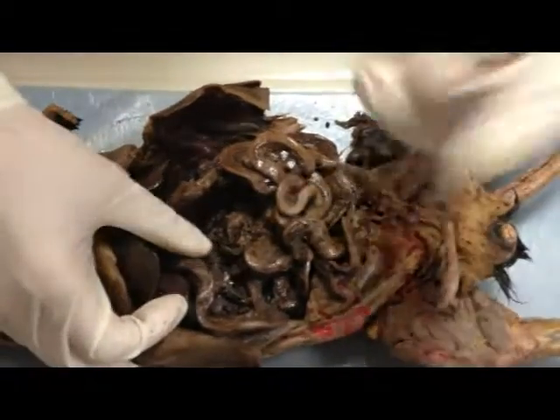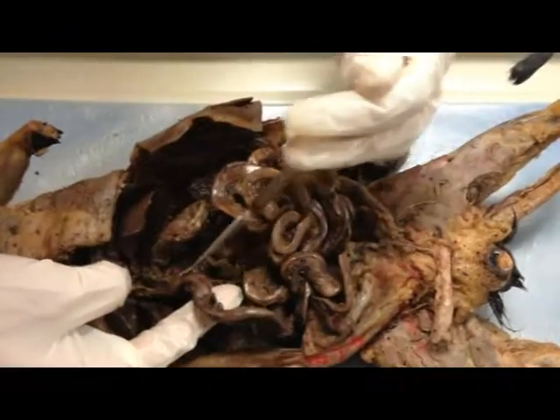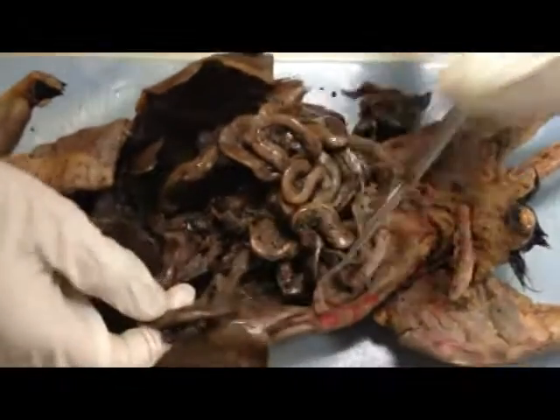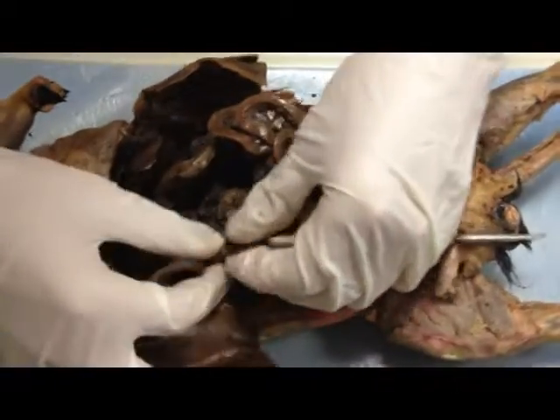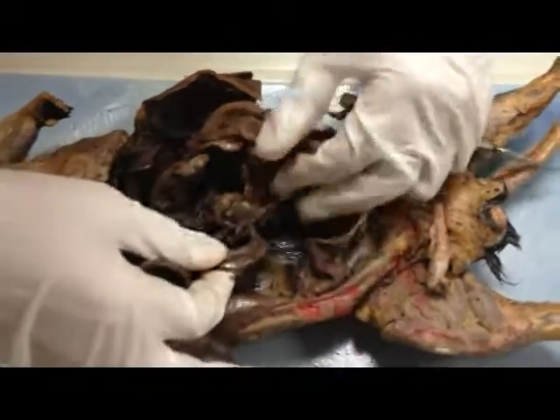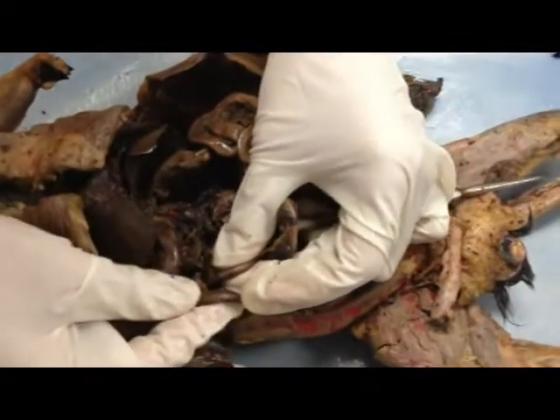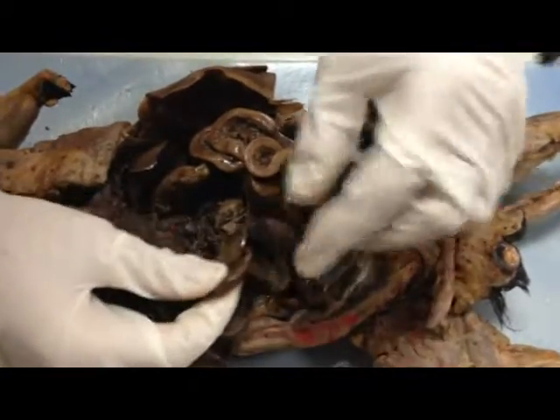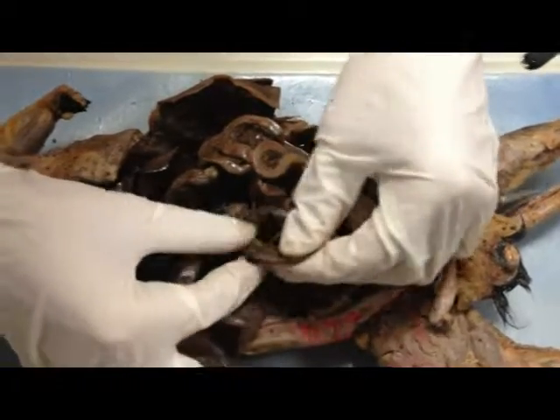This one right here is a darker tint — it's a lot darker. Then as it goes to a color change, it gets a little bit lighter. This right here would be the jejunum.